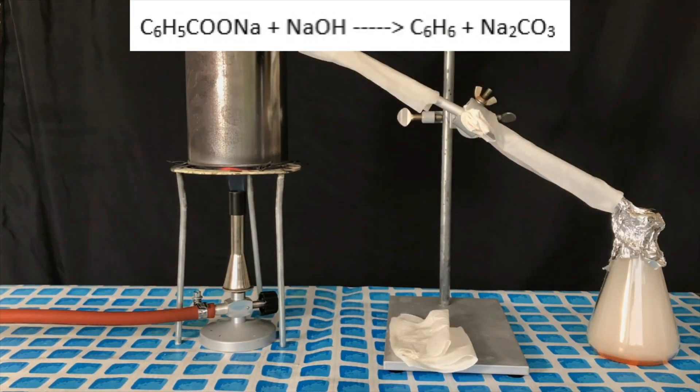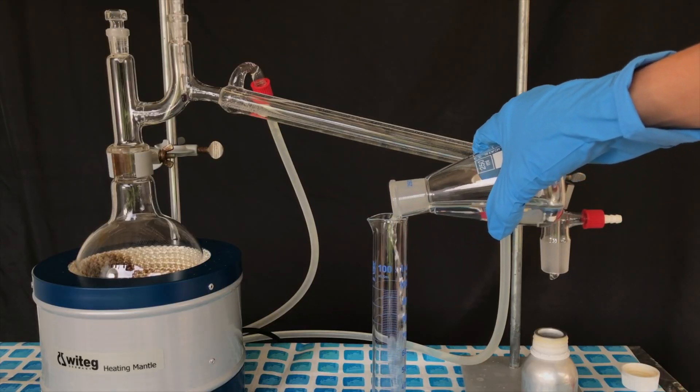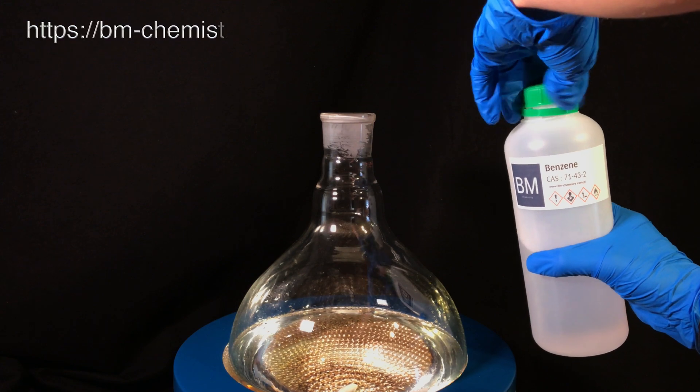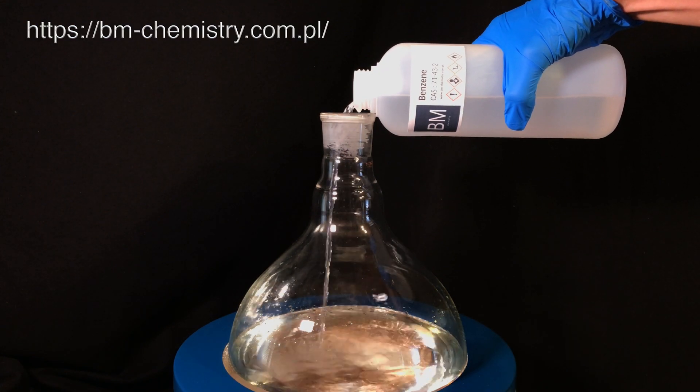You could make the benzene yourself and I actually did it in the past, but it's a potent carcinogen and I don't want to make it. So we got it from BM Chemistry in Poland and ended up using about 800 ml. The exact amount does not matter.